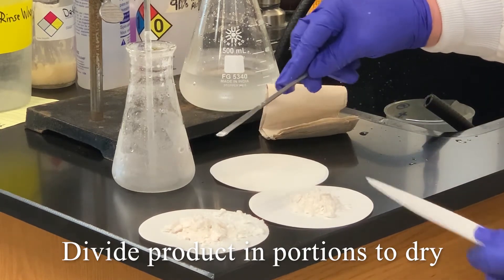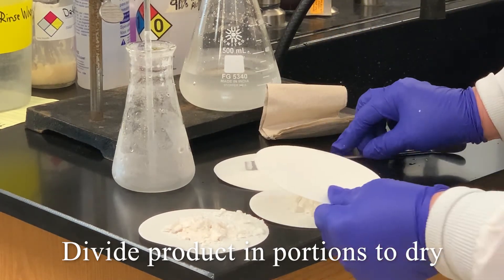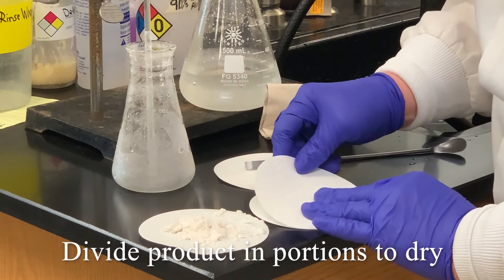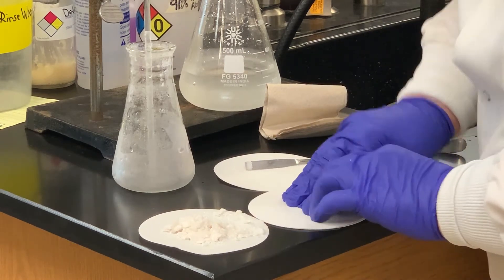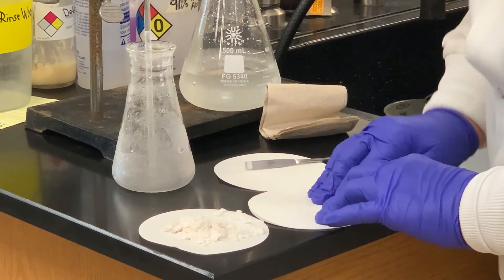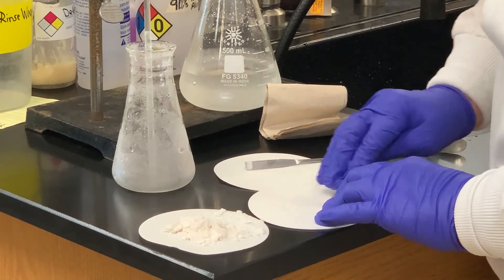Due to the large amount and the size of filter paper that we have, I'm going to dry this in sections. The only thing I'm trying to do is get rid of as much of that moisture as possible.